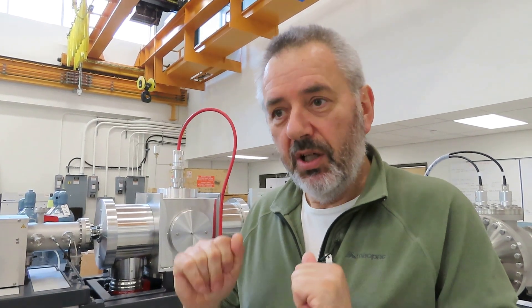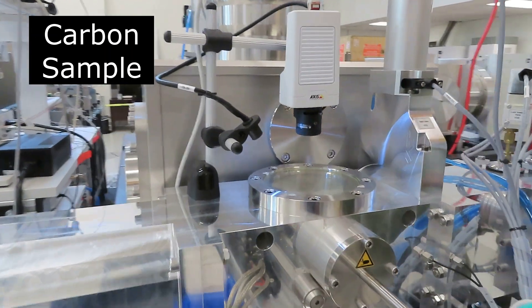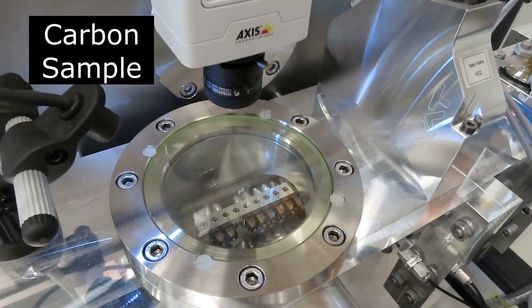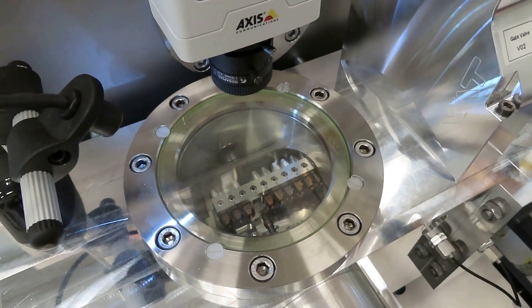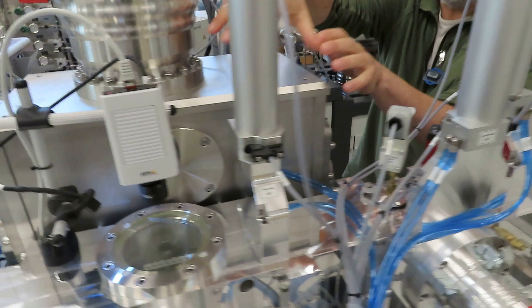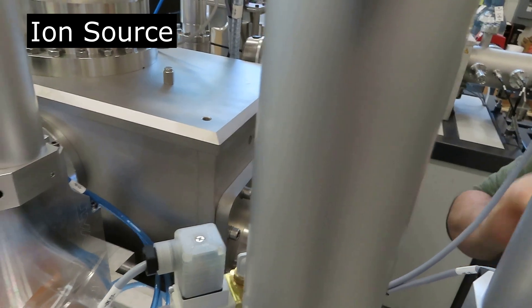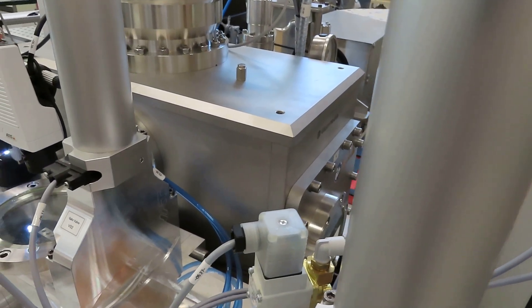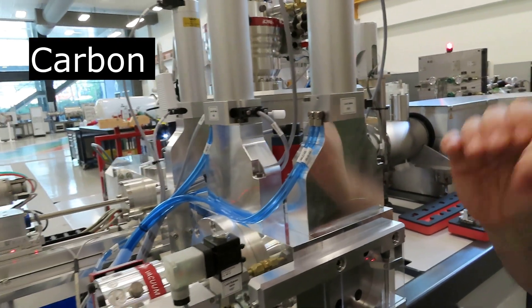Carbon-12 versus carbon-13 is only a factor of 100 from each other — relatively easy to measure. But for C-14, carbon-14, to be able to detect that, you need to do quite an effort. That effort starts here in this loading dock where the samples are mounted. You can see a tray of samples sitting there. They are inserted under vacuum into an ion source — that ion source right here. This big block is the ion source and it contains a device that converts some of the graphite — the sample graphite — into a stream of carbon ions. You collect all the carbon ions for all three isotopes.